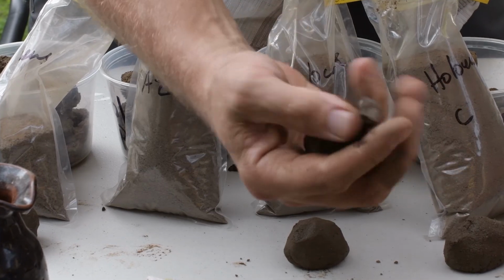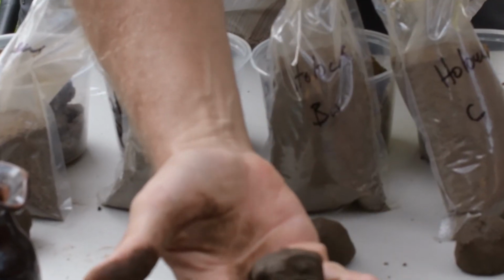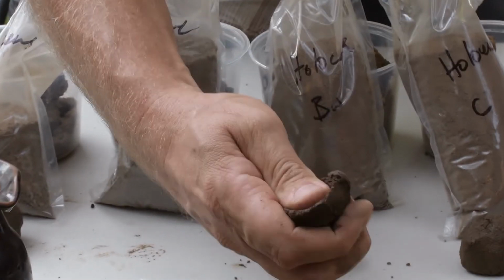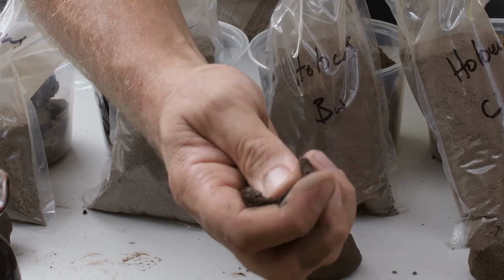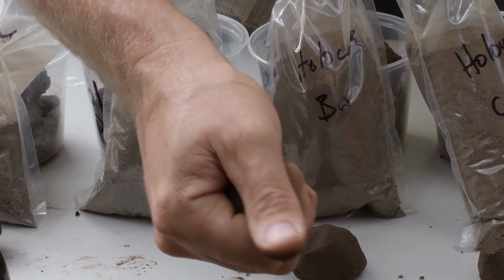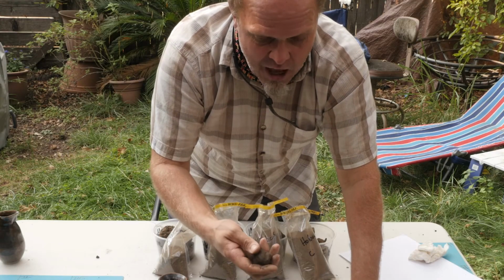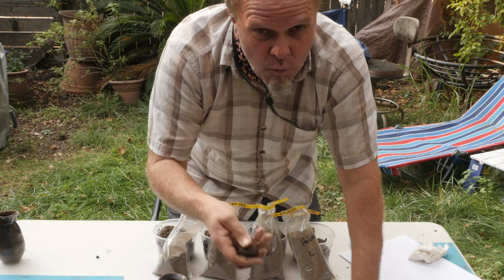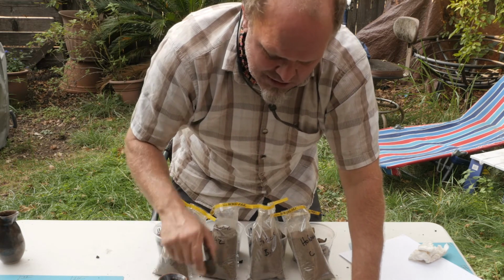Will it hold the ball? Yes, it holds together nicely. And then we would start our ribbon. So this one really doesn't want to hold together as much. And this is where sometimes organic matter content can be a confounding factor. It can help bind things up and act like a clay when it's actually not a clay in the mineral sense. And I suspect that's what's happening here.